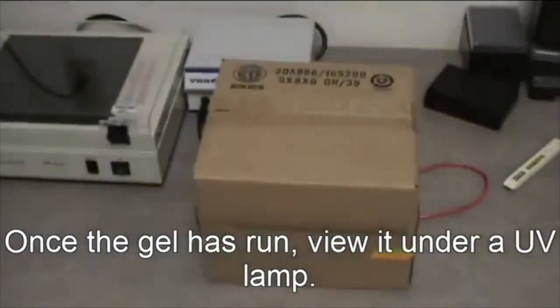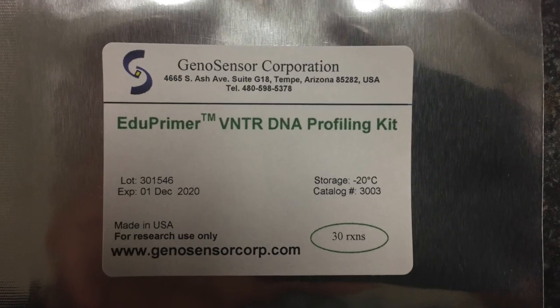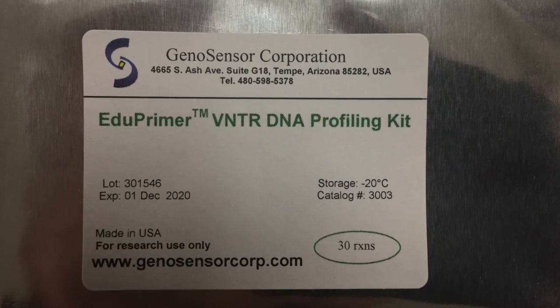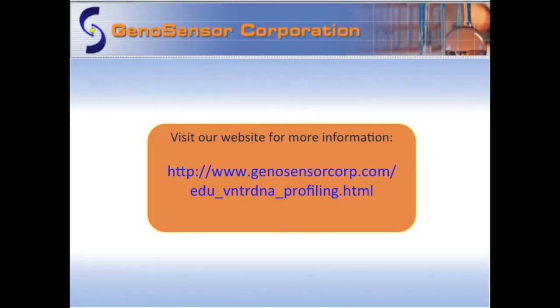Once the gel has run, view it under a UV lamp. For a full class, your gel should display the various VNTR genotypes. Please visit GenoSensorCorp.com for more information. Thank you very much for your attention.